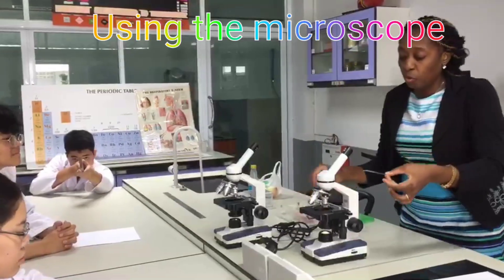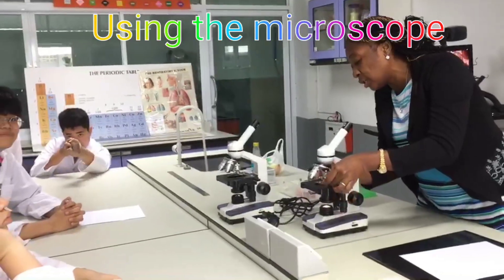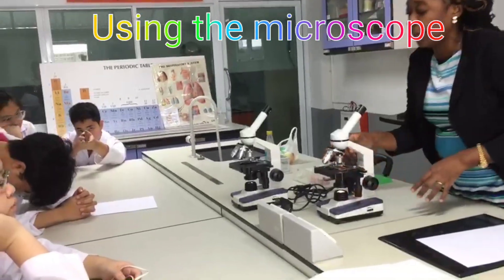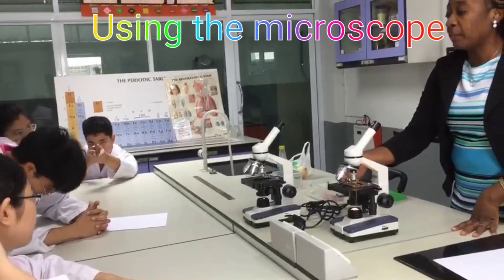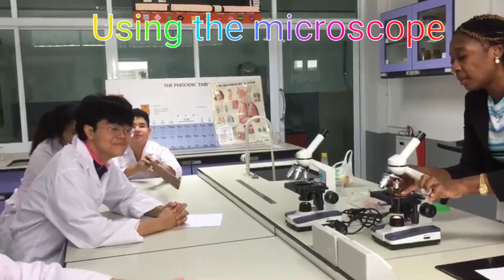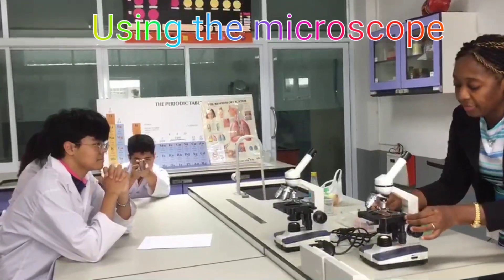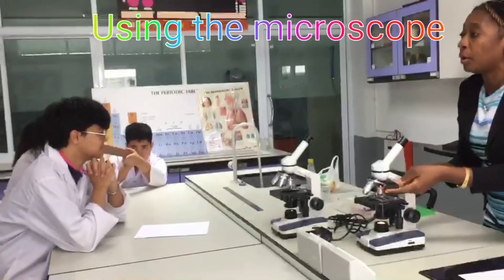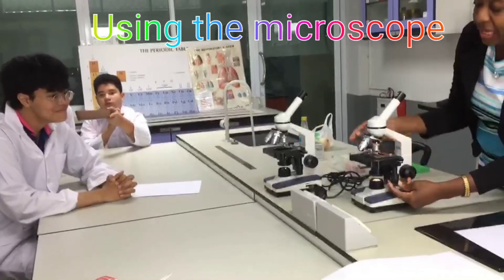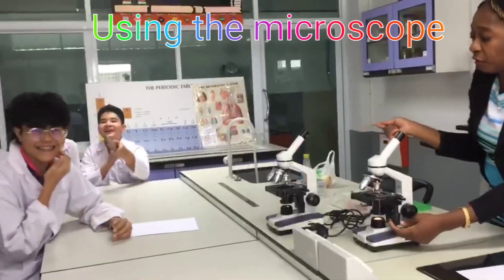You place your slide on the stage with your specimen, and you fasten your slide with the stage clip. Do not place the stage clip on top of the slide — just place the slide on the stage and then fasten with the clip. Then you start viewing on low power and adjust. You can adjust your stage going right or left depending on where your specimen is.